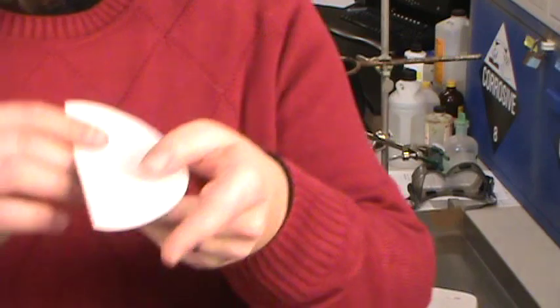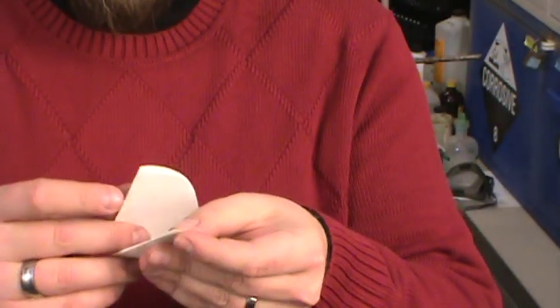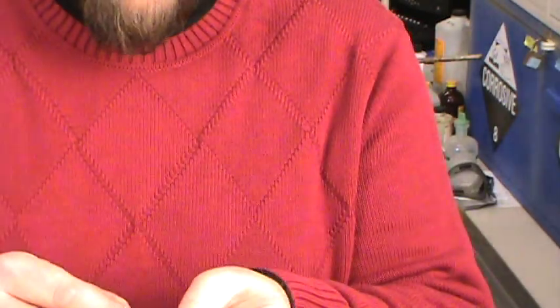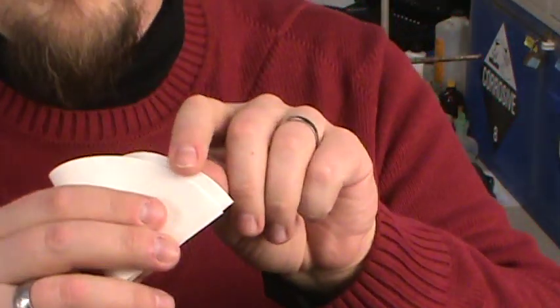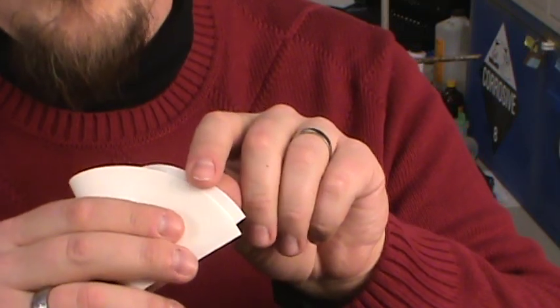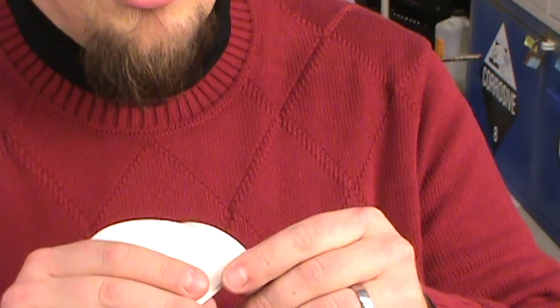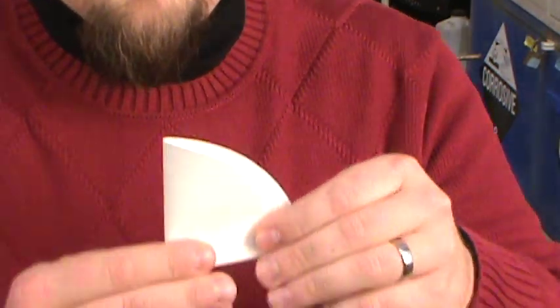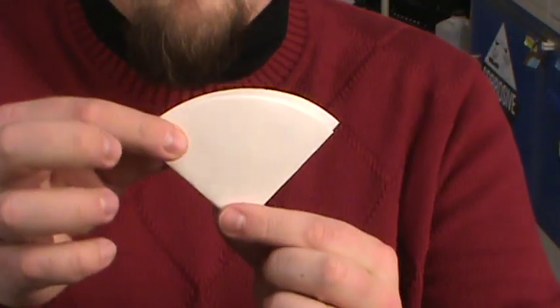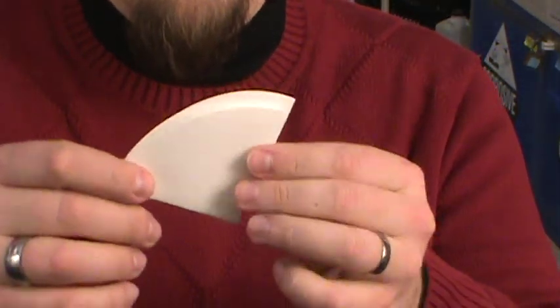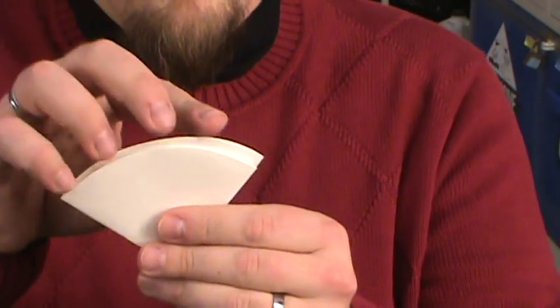Now on the second fold, this is the one that's really important. On the second fold it usually works better if you don't quite fold it all the way up to halfway, so you see I'm letting that gap just a little bit. And again, just give it a little press to fold. Now we've got approximately a quarter of a circle - I've got one arm that's a little shorter than the other.